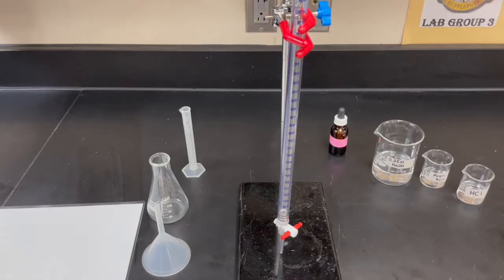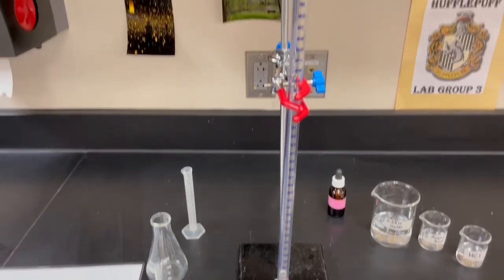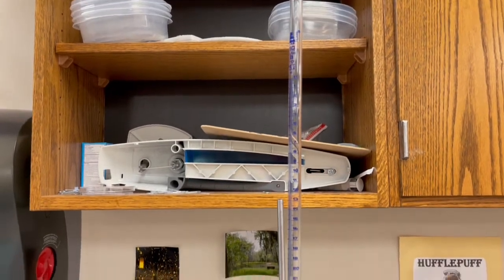Set up the ring stand with the burette and clamp. Make sure the burette stays vertical at all times. That's the burette.